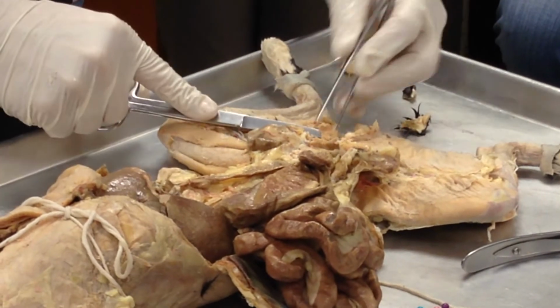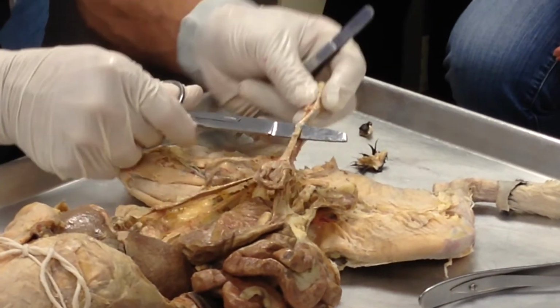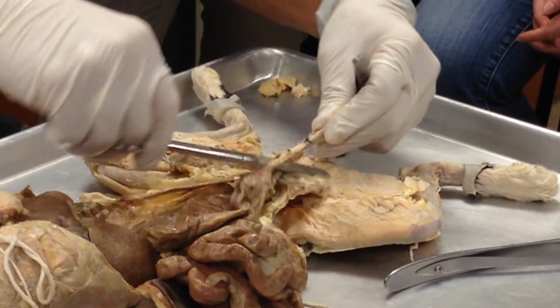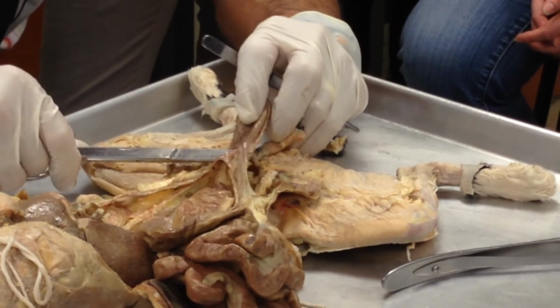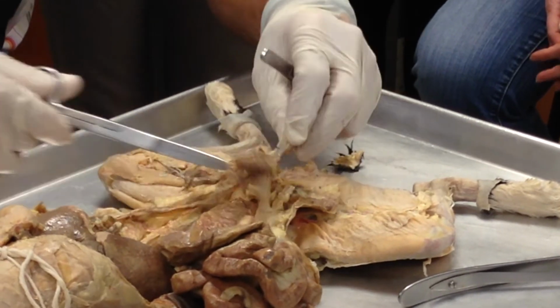Right, so now what do we see? Now, huge differences between human and cat, because there's my urethra right there, coming out of the bladder. There's the body of the uterus right there. So the horn and the body, you can see that forming letter Y. And so notice, is that like a cervix?